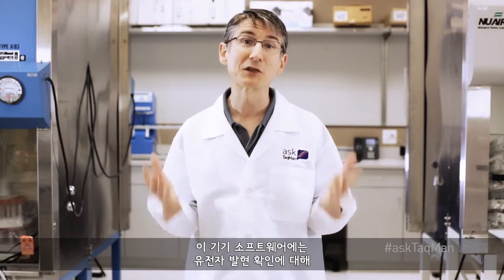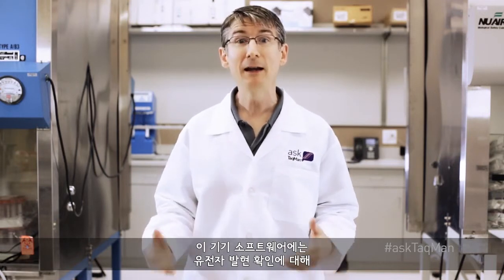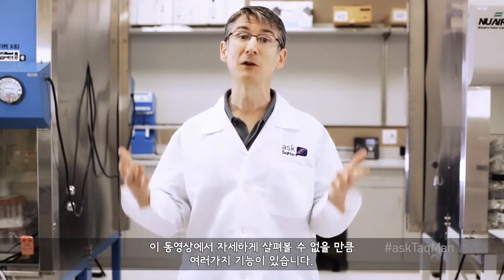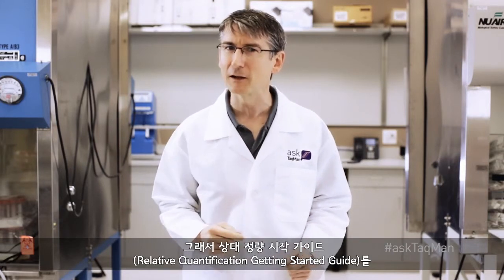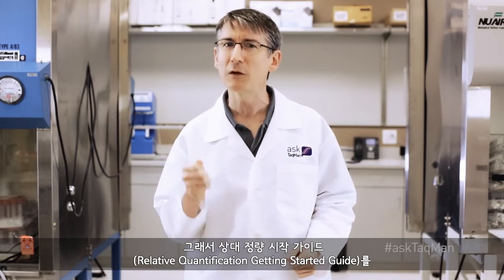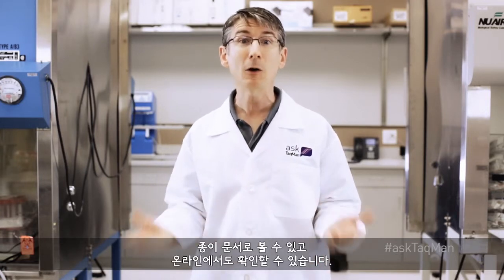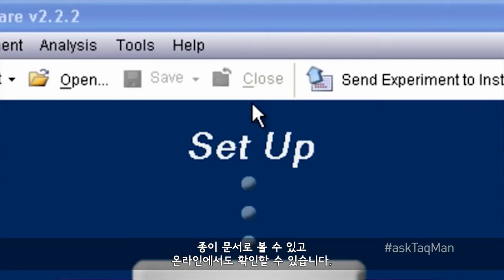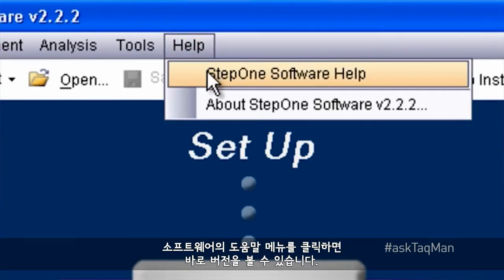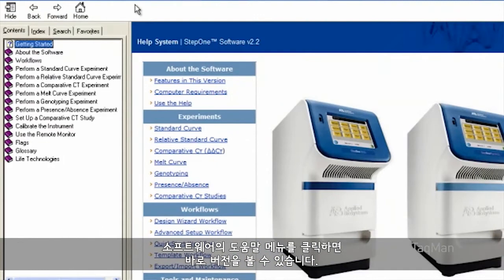The instrument software has so many features for looking at your gene expression data that we just won't have time to go into too much detail in this video. I suggest having a look at the Relative Quantification Getting Started Guide. It's available as a hard copy, as well as electronically online, and if you click on your software's help menu, you'll even find a version right at your fingertips.